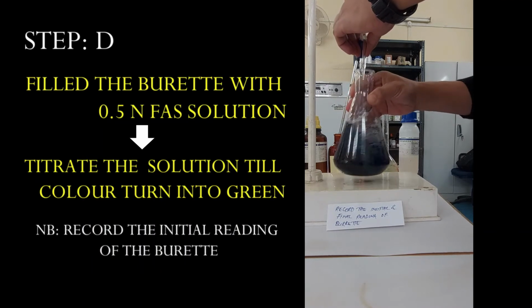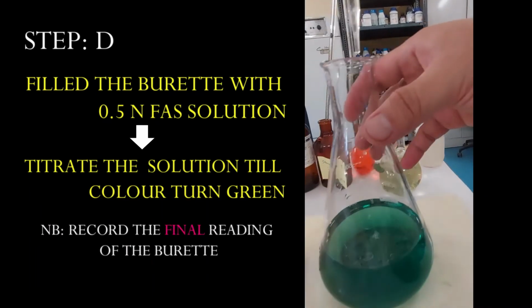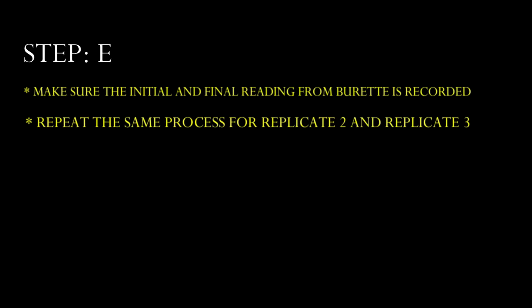After some time, you'll see that the blue color changes into green. So always remember to note down the final reading from the burette. So from this titration, you will be recording the initial and the final reading from the burette. In the same exact manner, repeat the same process for replicate 2 and replicate 3 for standardization of the ferrous ammonium sulfate in order to get 3 replicates.